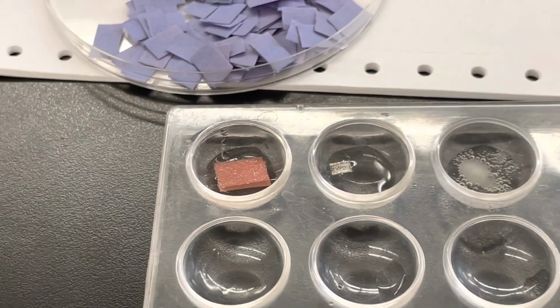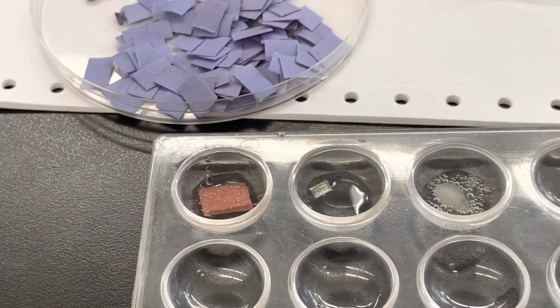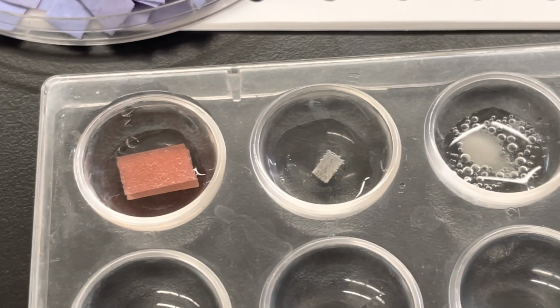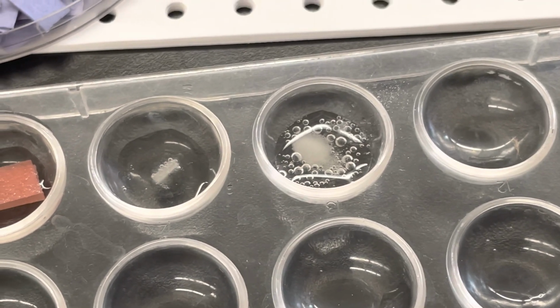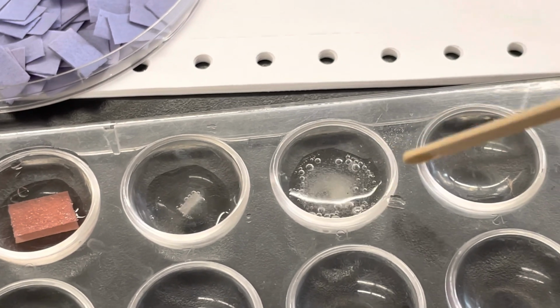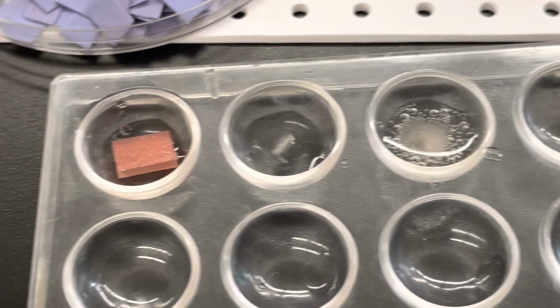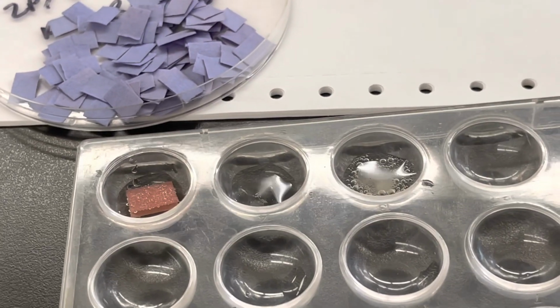Okay, so you can definitely see the color change in the litmus paper. Let's take a better look. We'll push the magnesium down and take a better look. We can see the little bubbles forming, and we can see the leftover bubbles here because this one reacted right away. Give it a little stir. We can see that the baking soda and our substance reacted. We can see it bubbling a little more now that I just stirred it around a bit. Okay, so that tells us whether we were successful in making an acid or not.